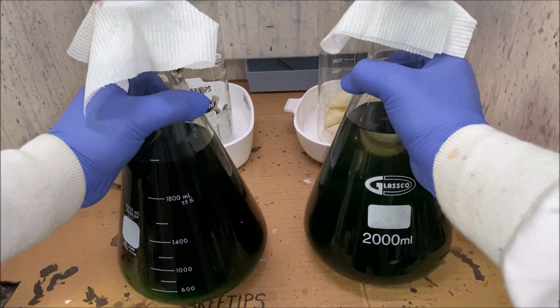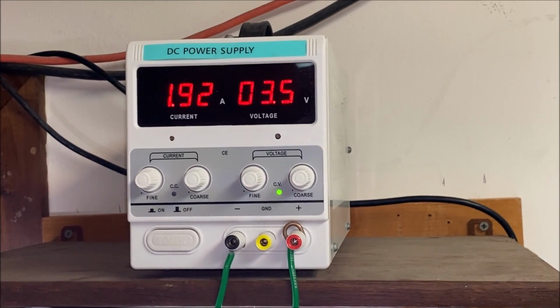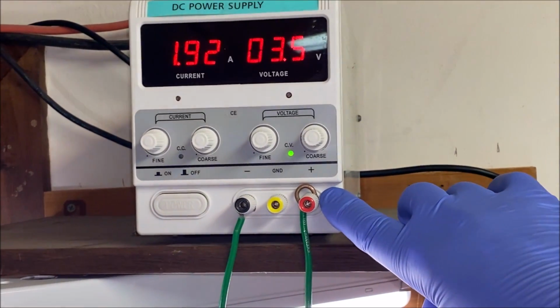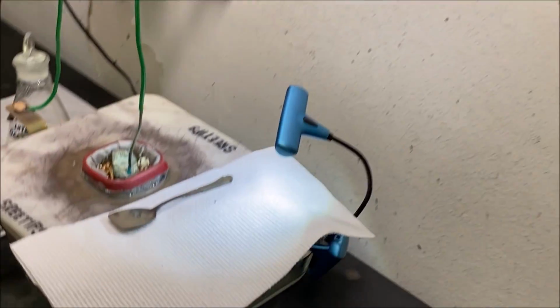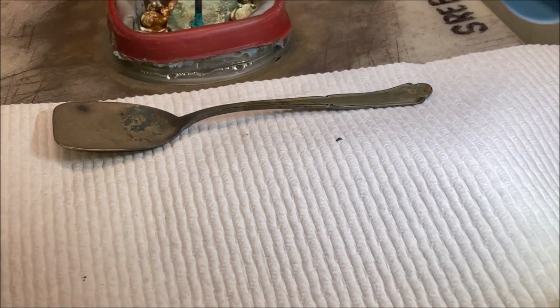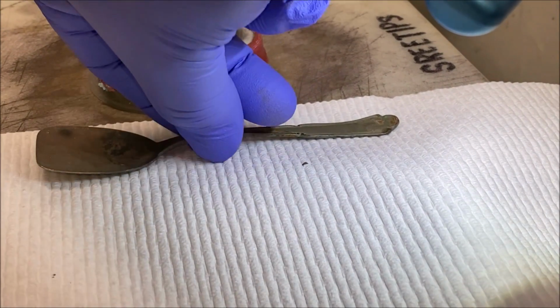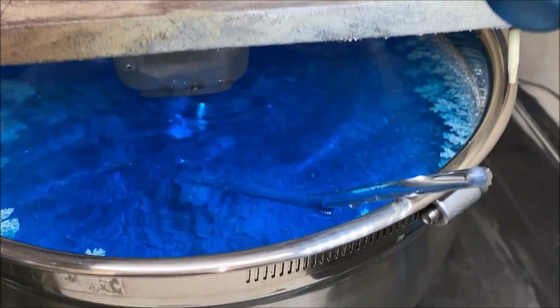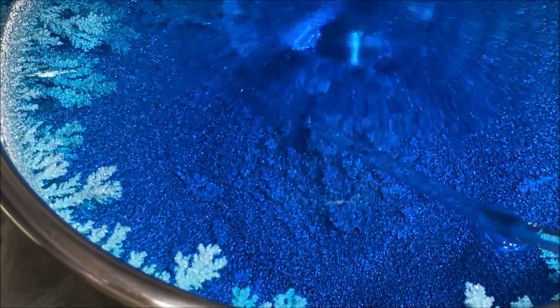Here's our silver cell cranking along at 3.5 volts, 1.9 amps. I've got a wire to spare here. I'm going to fix that. But if we look down here at the cell itself, this is about 3 days worth of growth in here. And we're going to look inside the silver cell and look at the glory of that, man. Look at that beautiful pure silver crystal growing in there.